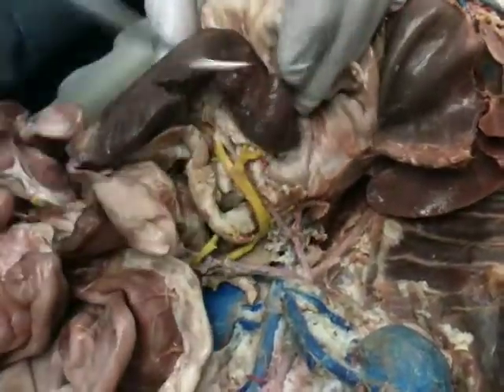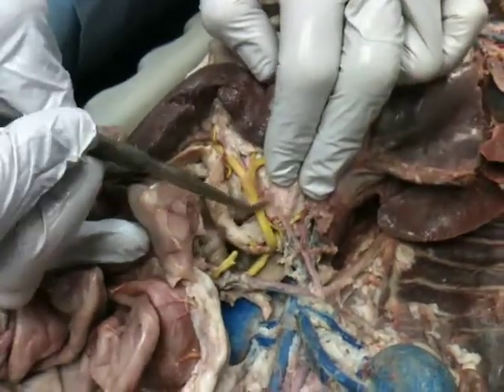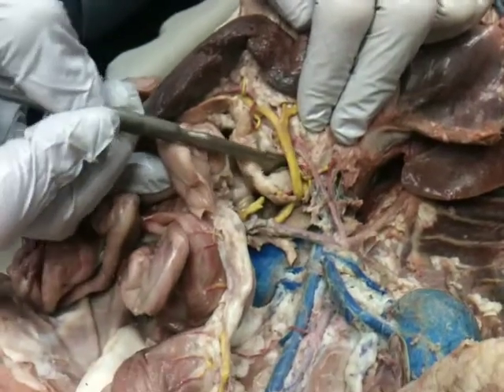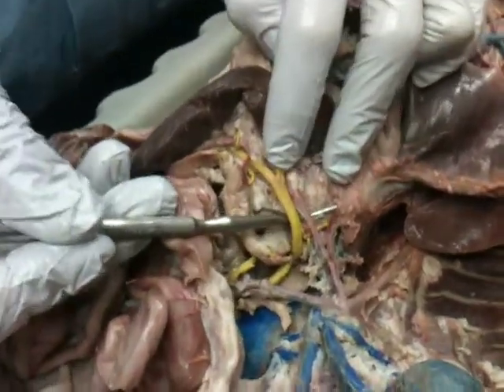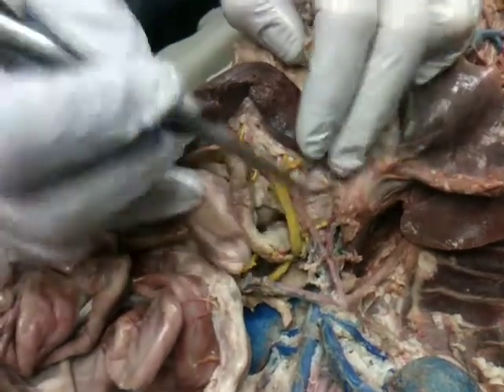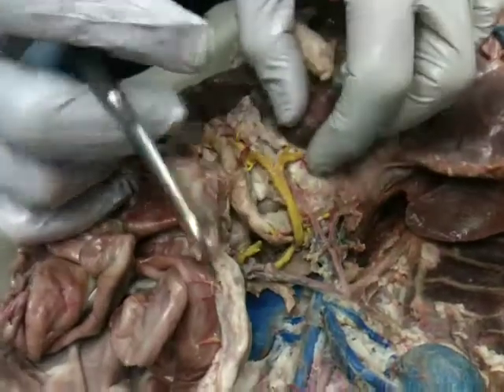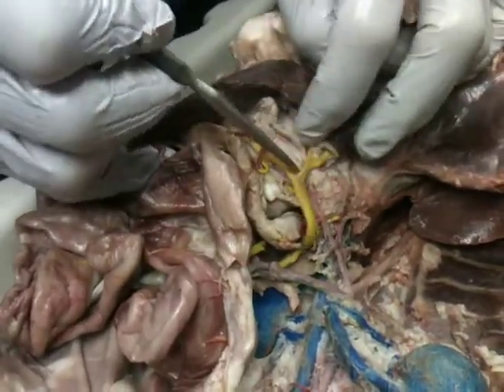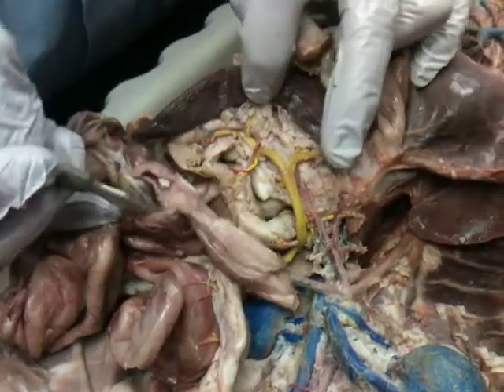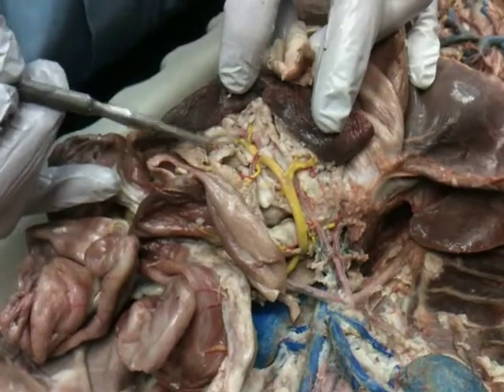Oh, I forgot to mention this organ. What's this guy? Spleen. So you know the vessels coming to it are the splenic. Okay, splenic. The veins and the arteries go together here. So the splenic artery and splenic vein. Okay. It does divide into anterior and posterior. And there are a few of the branches coming off, anteriors and posteriors. Same with the veins, anteriors, posteriors.